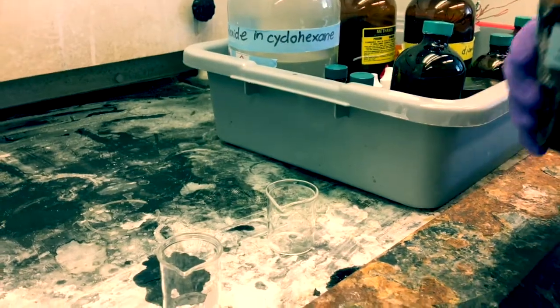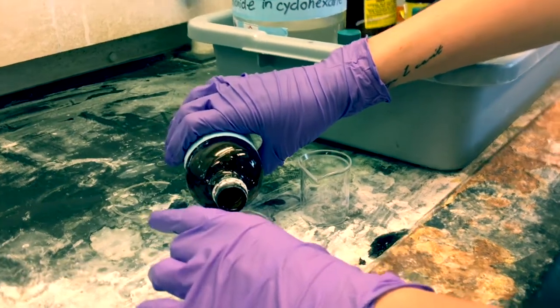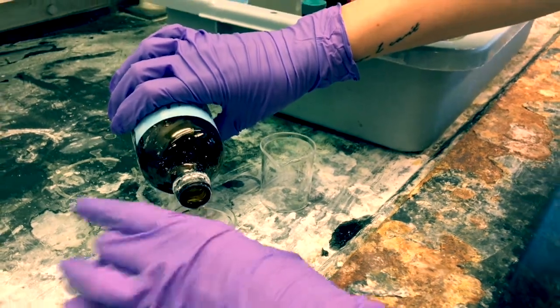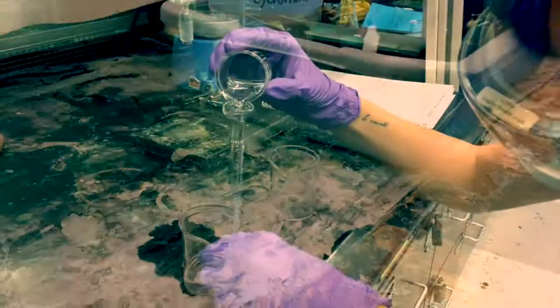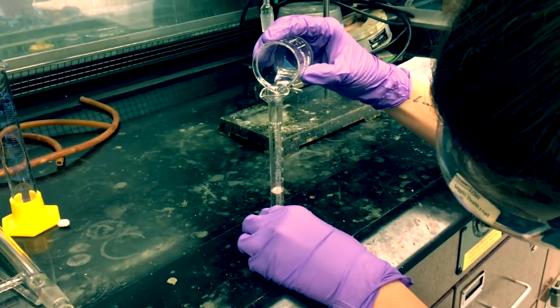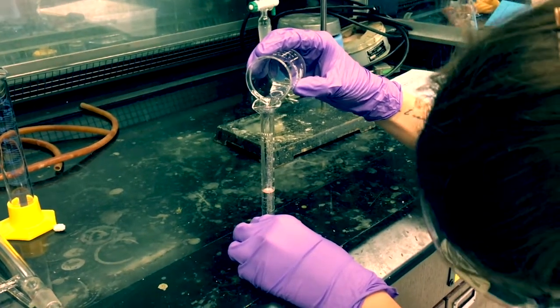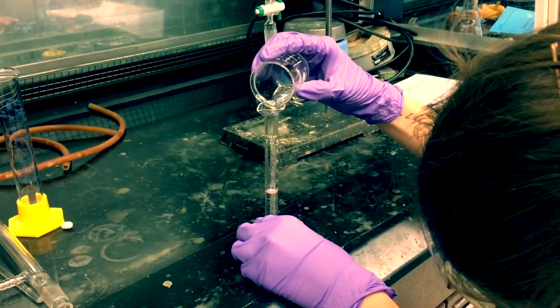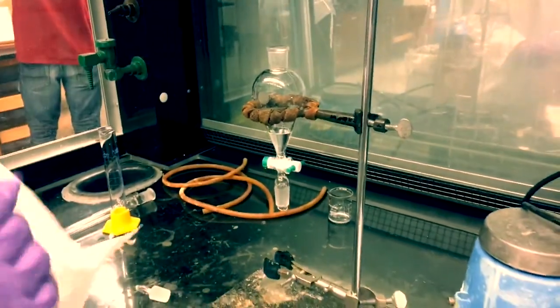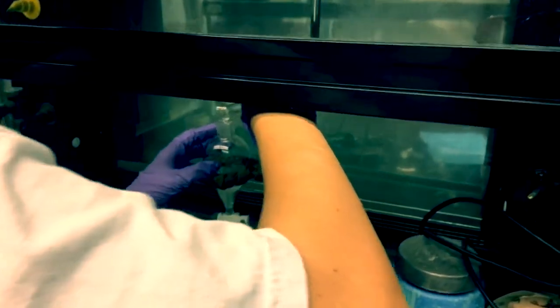To start off the experiment, collect 2 mL of 3 molar sodium hydroxide. Then, using a 10 mL graduated cylinder, gather 8 mL of water. Place 5 mL of commercial styrene in a separatory funnel and add the 2 mL of 3 molar sodium hydroxide and the 8 mL of water.